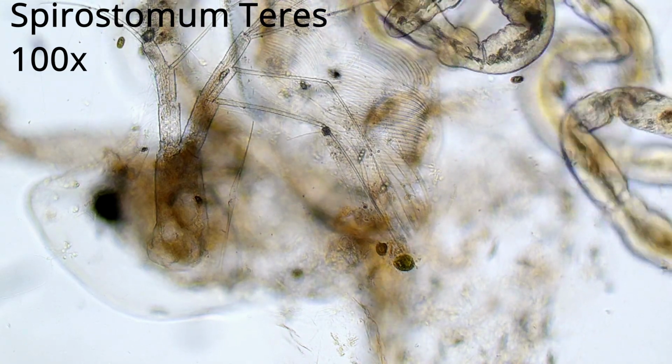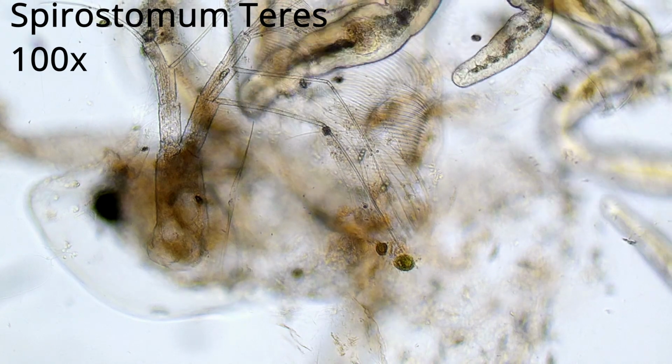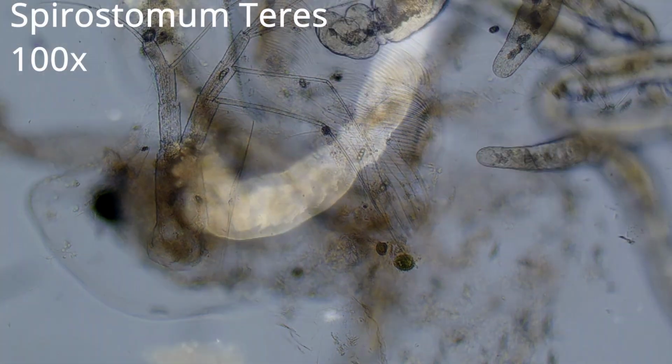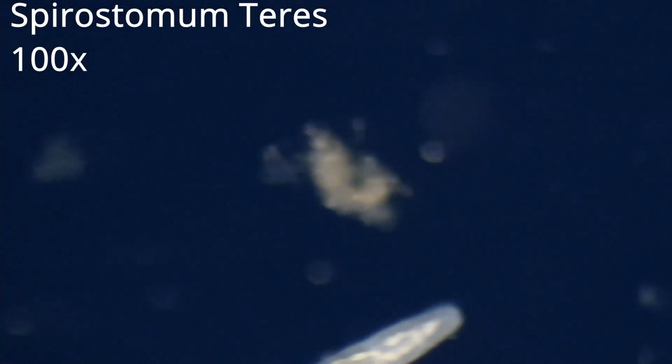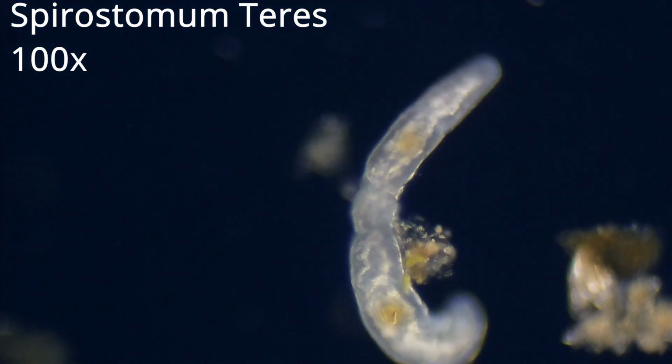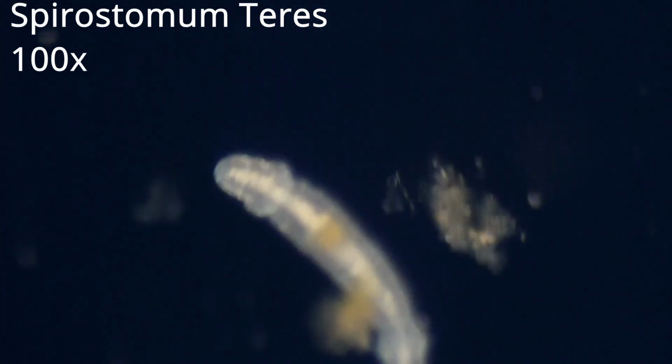After posting the last episode, I noticed the quality of the footage was a little off, so I decided to place an addendum with better material. This is definitely a Spirostomum teres. Just my luck, no species named after me.